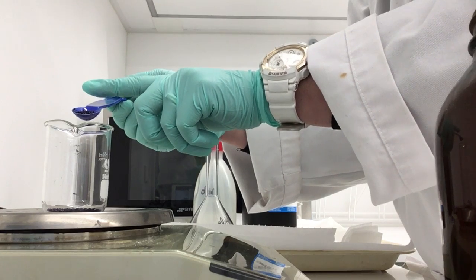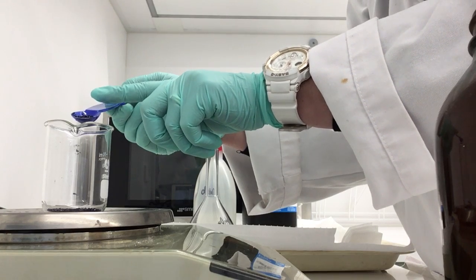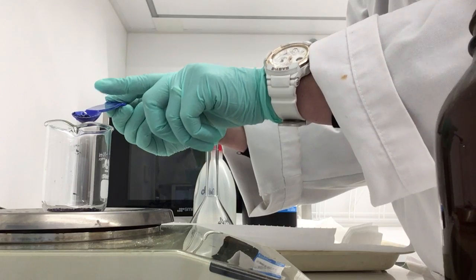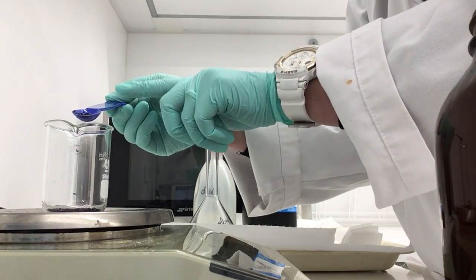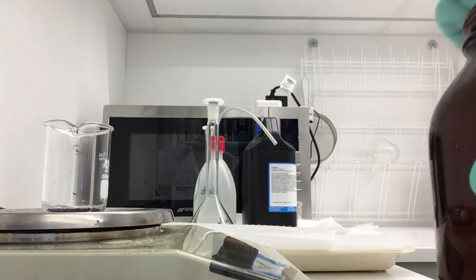Alright, about 0.67, keep going, it's nearly there. 0.78, I like it to be exact, 0.79.